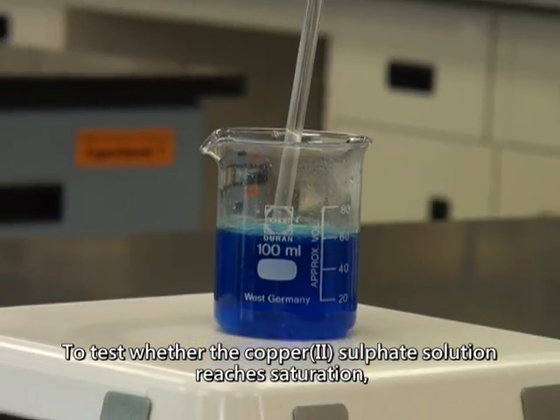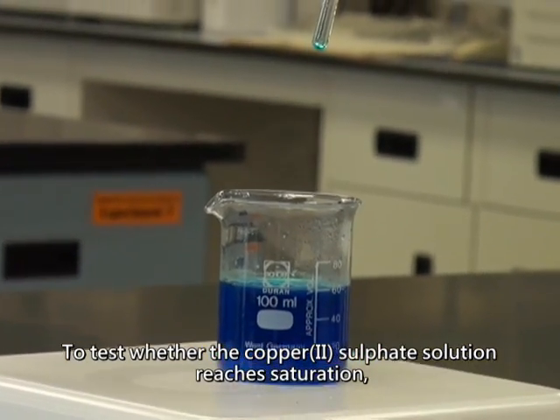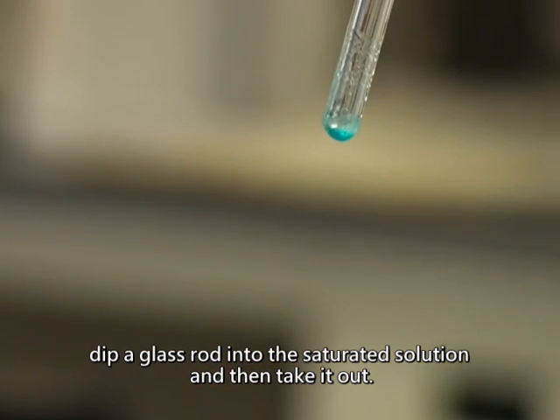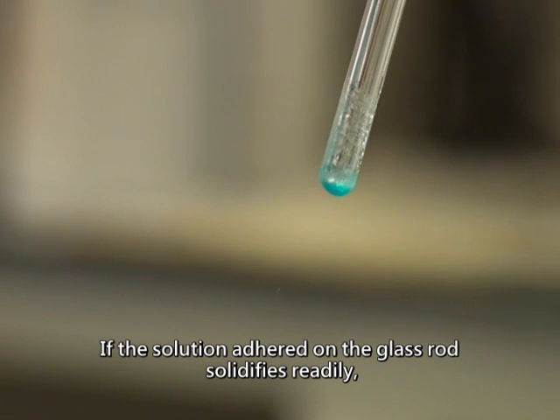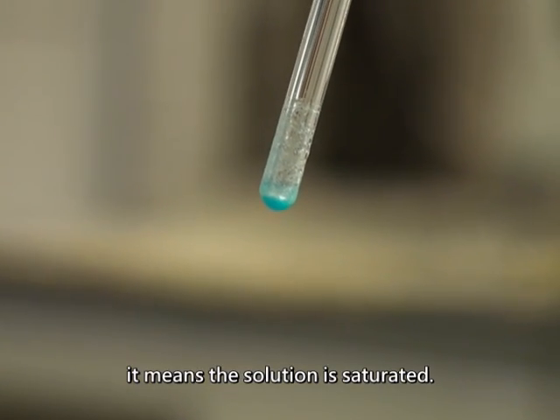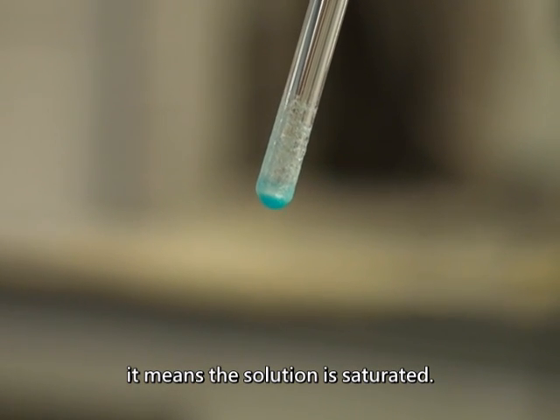To test whether the copper-2 sulfate solution reaches saturation, dip a glass rod into the saturated solution and then take it out. If the solution adhered on the glass rod solidifies readily, it means the solution is saturated.